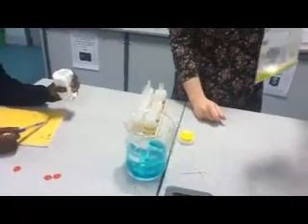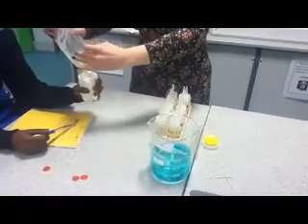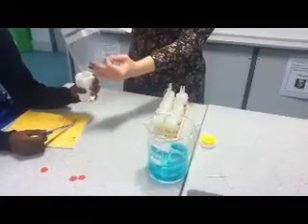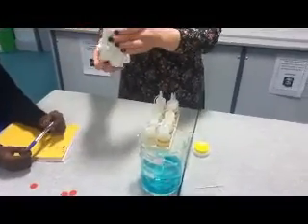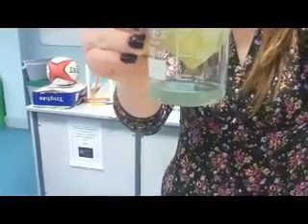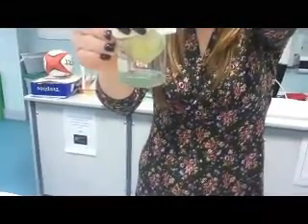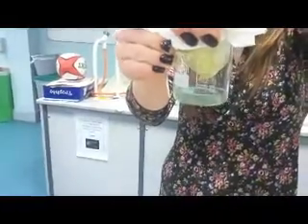It's all banana bits of cells and it's got the DNA floating around now, but we just want the filtrate. Leave it for maybe five minutes or so, and there'll be some questions on the board for you to answer in your books. How come we can't see the DNA yet? It's microscopic — we can't see it with our eyes. We would need a special microscope to see the DNA. But the DNA is small enough to go through the holes in the filter paper.